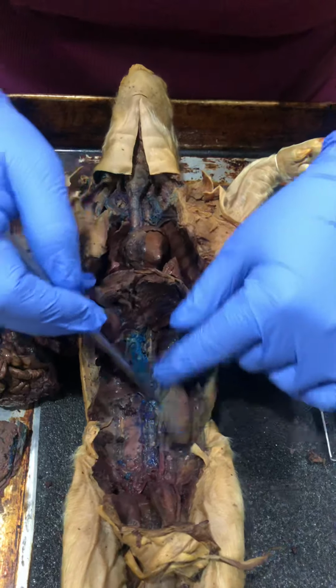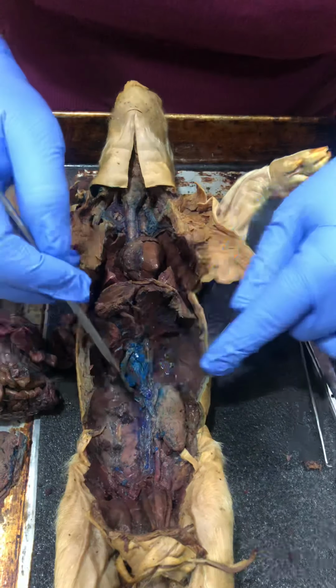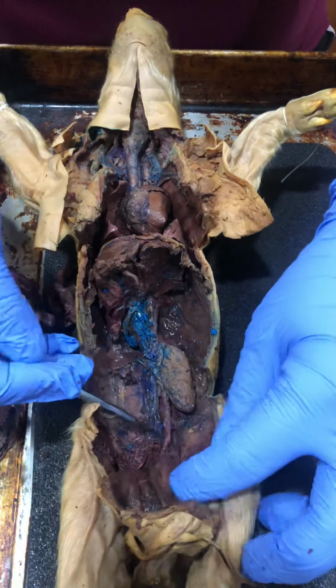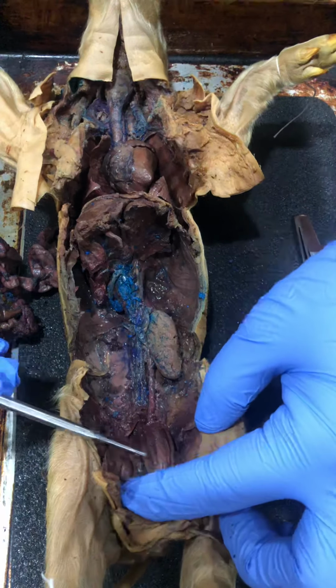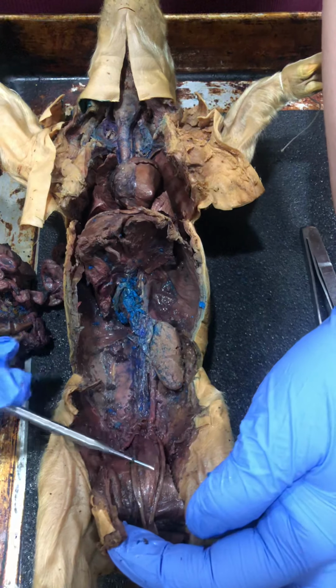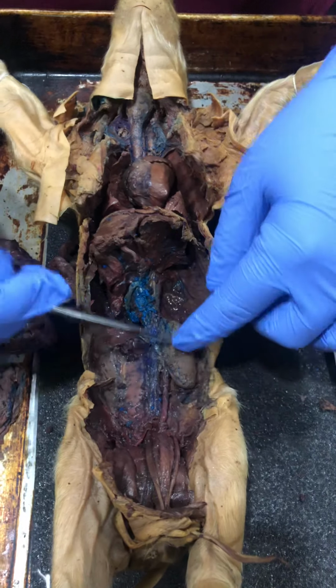So here's the kidney. This part right here through the middle, and up here you can see is the aorta. But so here's the kidney. If I follow it down, here is a ureter, and then tracing it all the way down, it comes to this right here. I was a little bit confused to see where the bladder was because the picture showed differently, but right here it tells me it's where the bladder is at. So that's the urinary bladder, the ureter, the kidney.